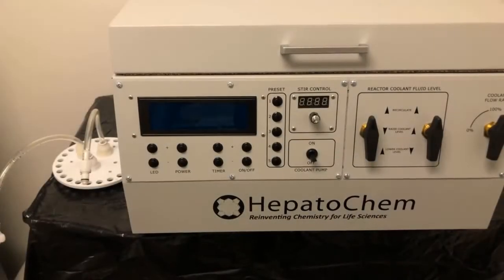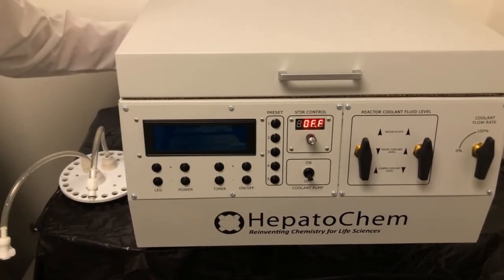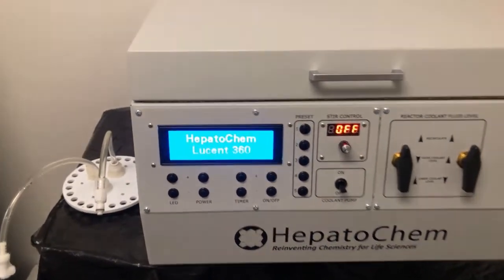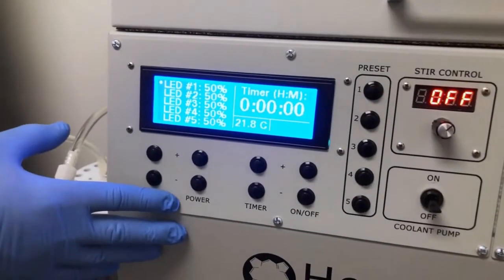Let's get started. First, Mick, a little help? The LED buttons allow you to control the intensity of each module.